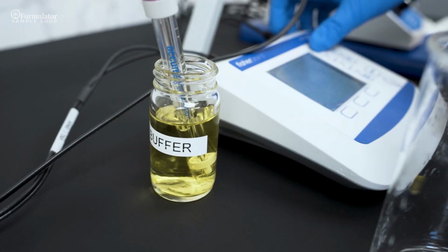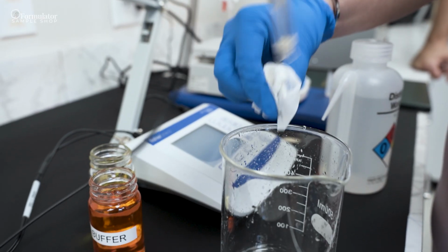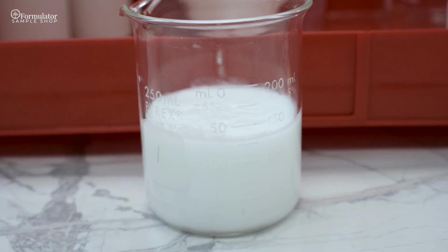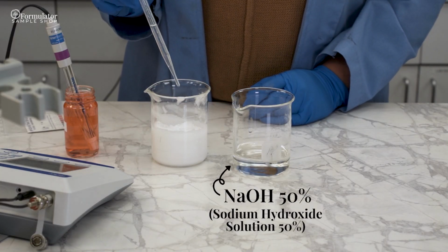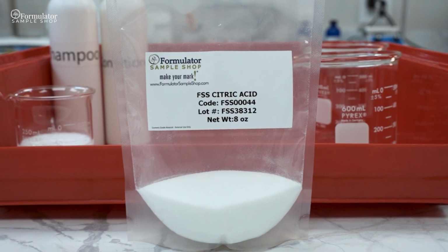Once you place the probe in the solution, you let it stabilize. Once stabilized, you can determine the pH. Our current pH of this lotion is 5.35. pH can be adjusted with pH adjusters. The most used pH adjusters are NaOH 50% and citric acid 50%.